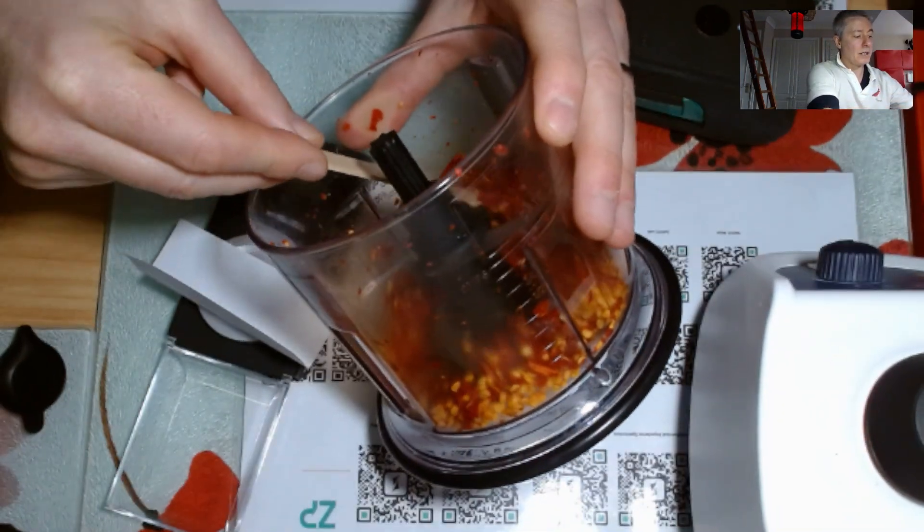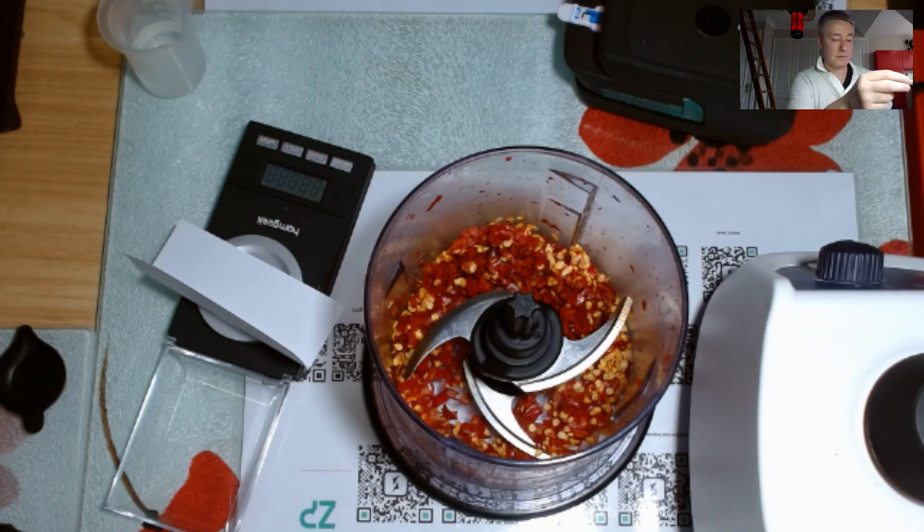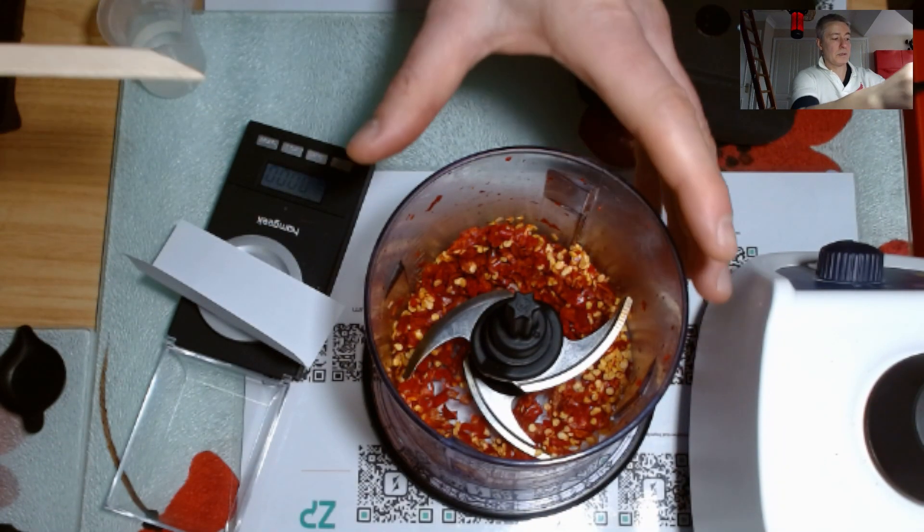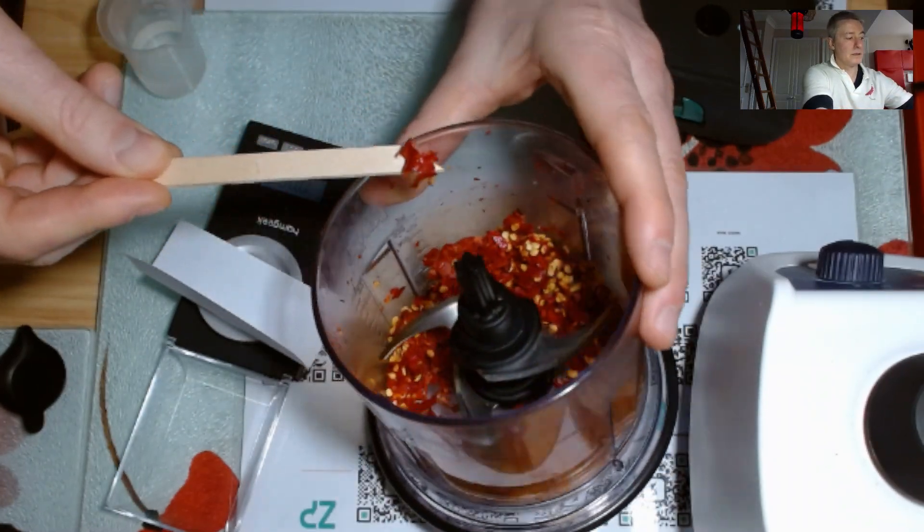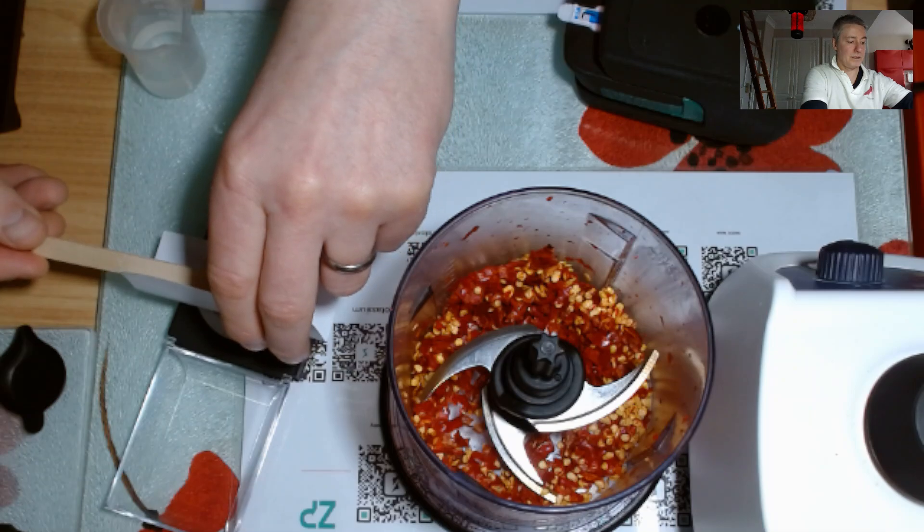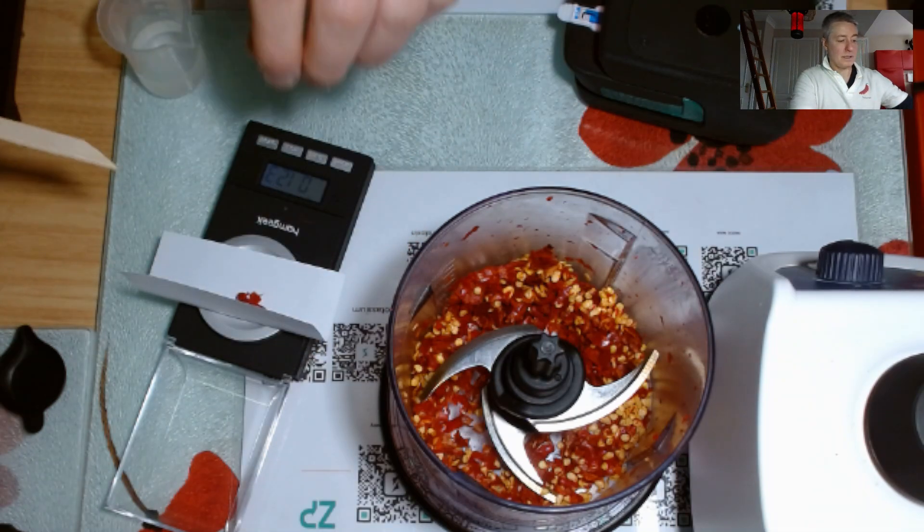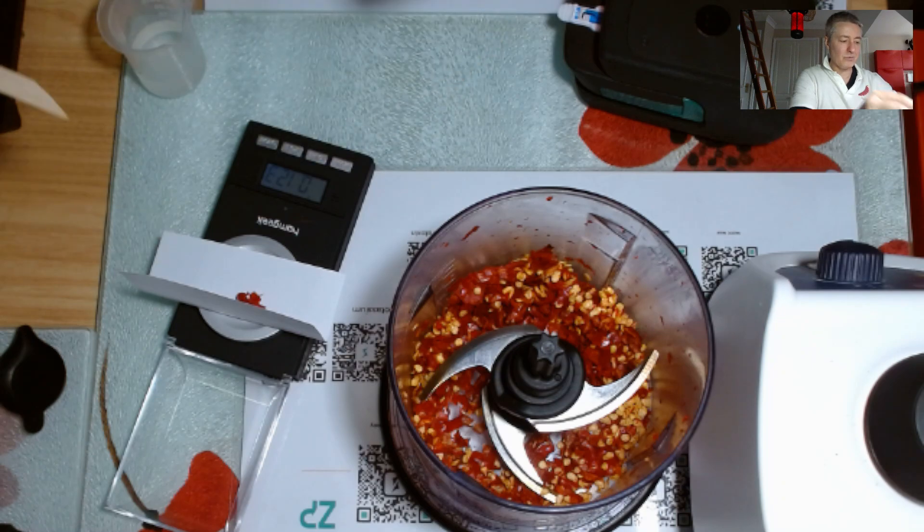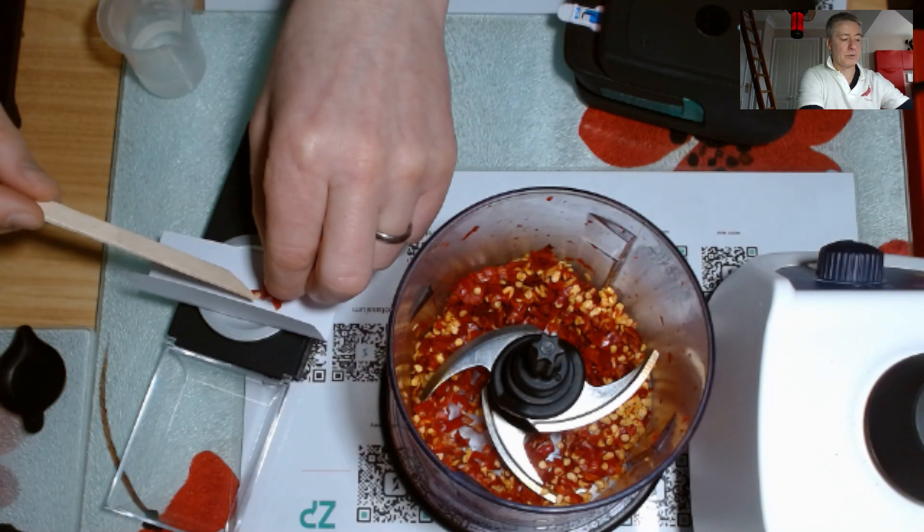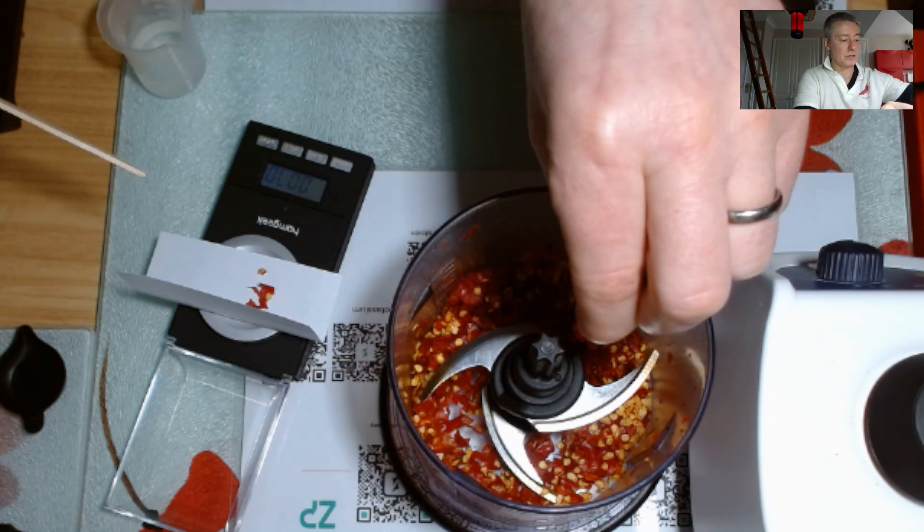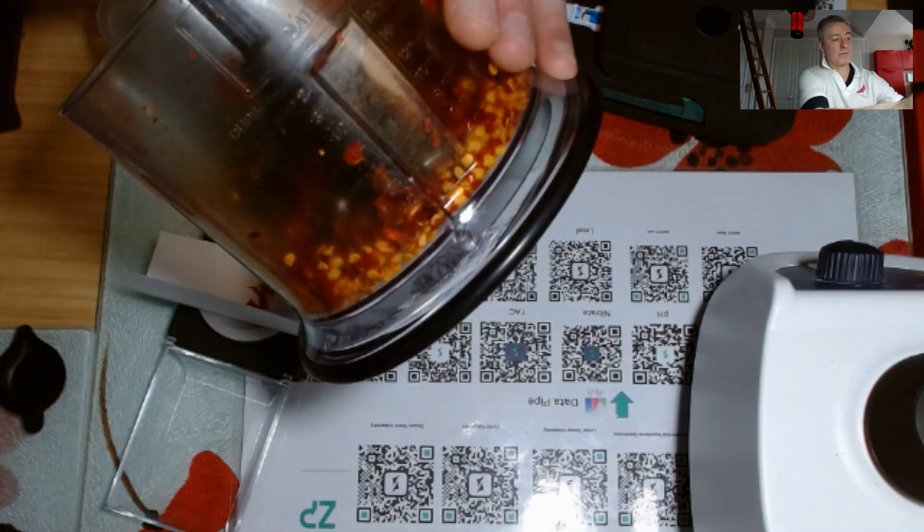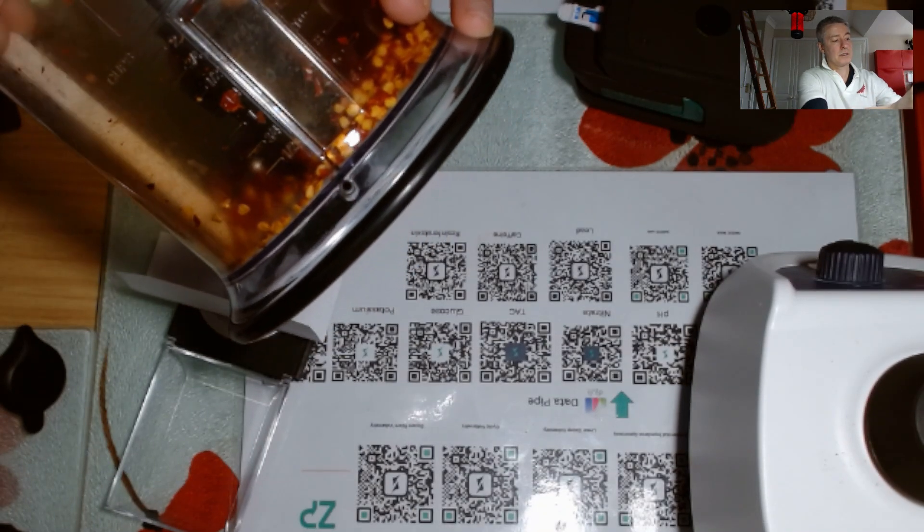Now what I'll do is turn on my balance. Alright, so I've turned on my balance. I will take some of this. That's gone over. I'm really just looking for about 0.1 grams. I don't really want to be handling all this, but I'm doing this demo almost live, so I'll be doing things I don't really want to do, but just for the consistency of the video I will do those things.